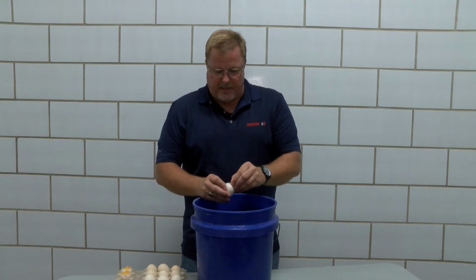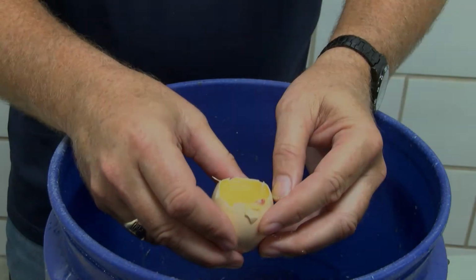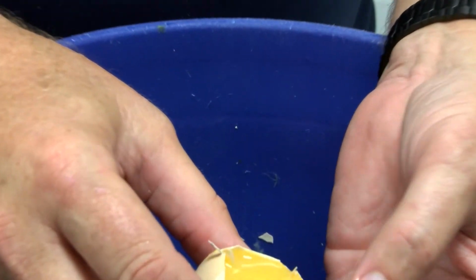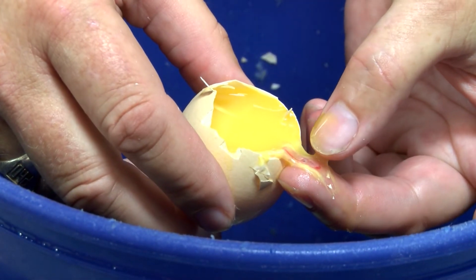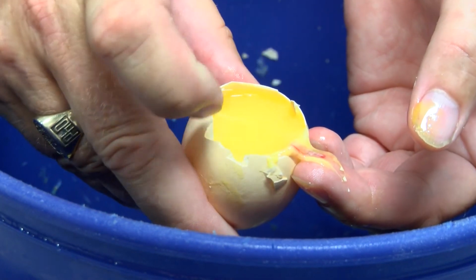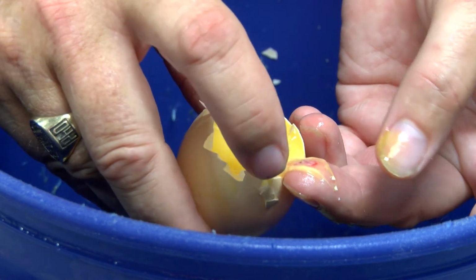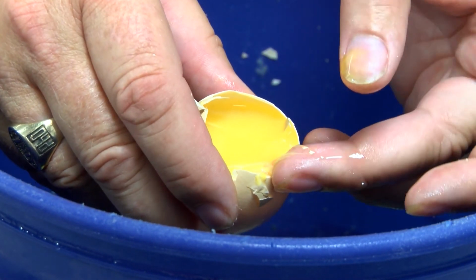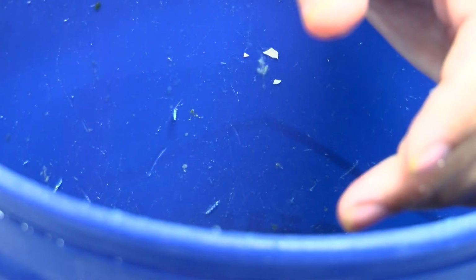And this one, immediately, as soon as I start opening and I see the membrane is very white, as we pulled this, we can actually see the embryo here. Small little remnants of the embryo. If you look real close, we can see right here would be the embryo itself with the blood support that was around it. This blood was wrapped around that yolk, and as we pulled it apart, it came apart a little bit. So now we know this was a fertile egg, and we had some early dead mortality in the first 3 days from that egg.